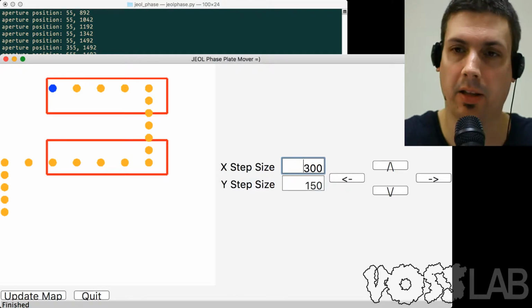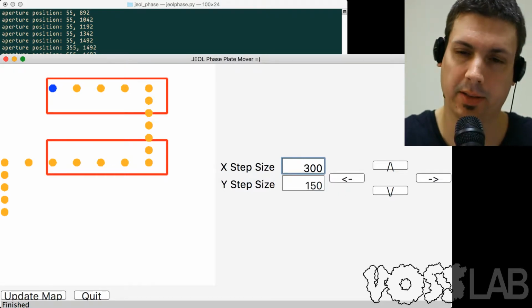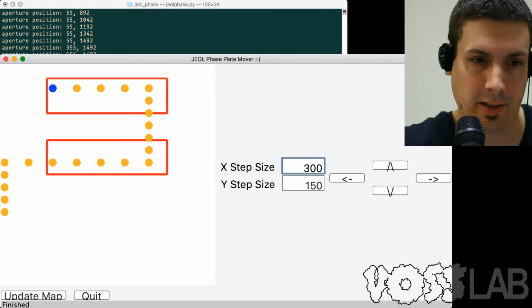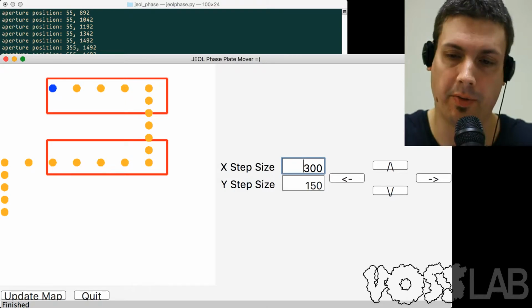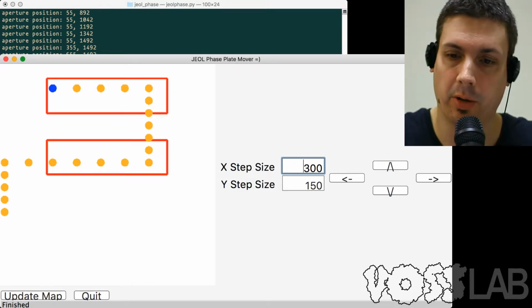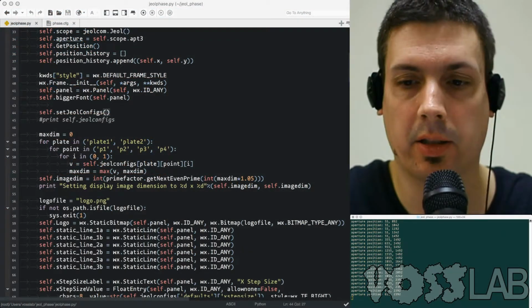We're much more zoomed in than the last code on the location of the phase plates. When I got to the microscope, I realized we really want to focus on that area. And at this point, I'm not checking to see if you're going too far away from the phase plate. I leave it up to the microscope to complain when you go too far. So, all right, back to the code here.